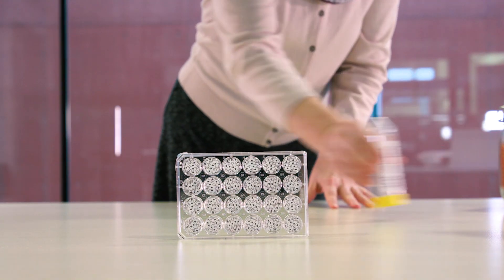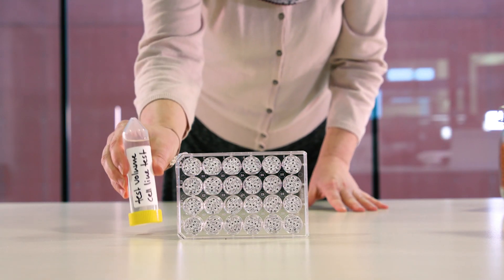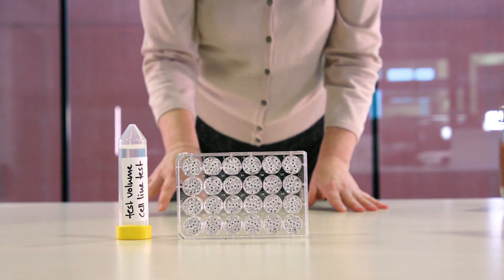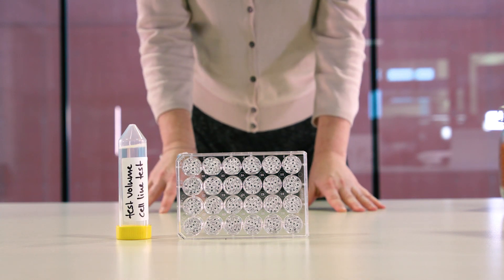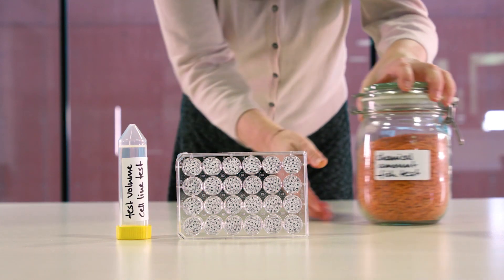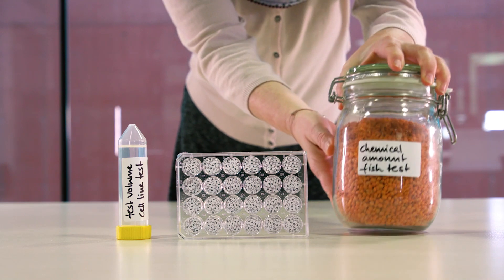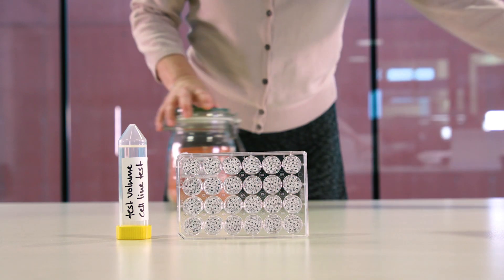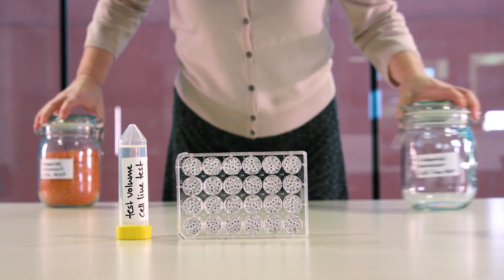Instead of liters of water for the fish test, we now only need a few milliliters. And instead of kilograms of chemical, we get away with a very tiny amount.